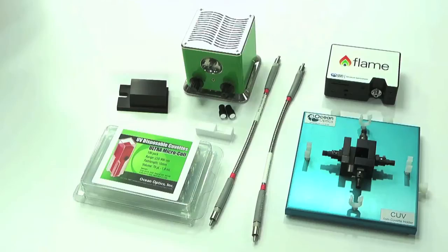The equipment used was the Flame S VIS NIR spectrometer, two premium UV VIS fibers. Each is 25 centimeters long and has a fiber diameter of 600 microns.